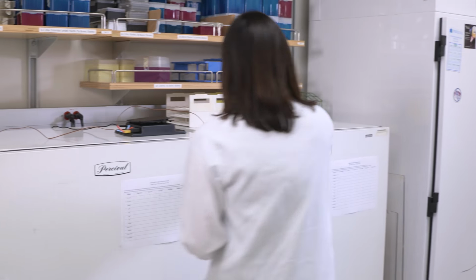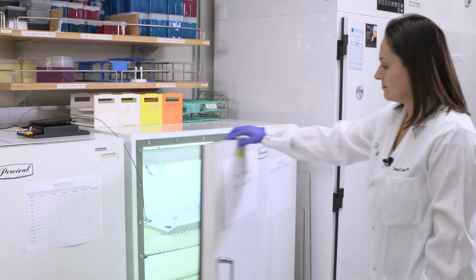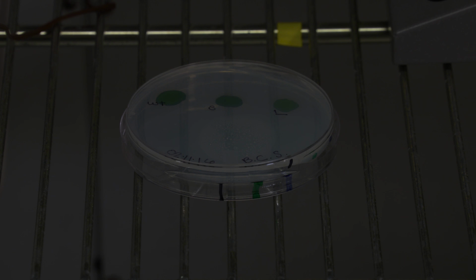In their natural habitat, the bacteria would entrain to the environmental cycle driven by the rising and setting of the sun. In the lab, we use incubators with timed lights to simulate the environment. This also gives us the flexibility to plan our experiments without having to come in at dawn. Once the bacteria of interest are inoculated onto a plate where they will grow and be measured for the duration of the experiment, they are placed in the incubator and left to entrain to a light-dark cycle with lights on for 12 hours and lights off for 12 hours, otherwise known as LD 12:12.